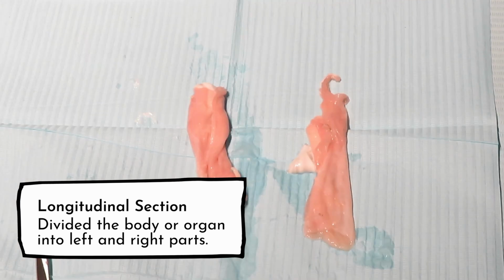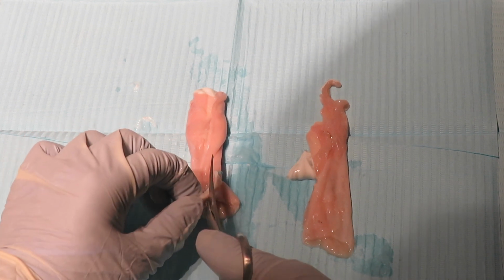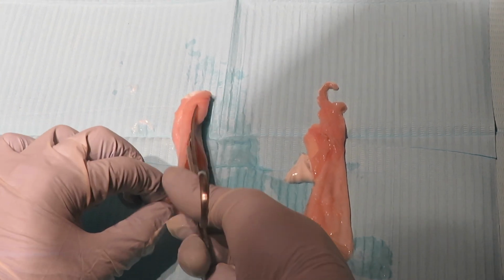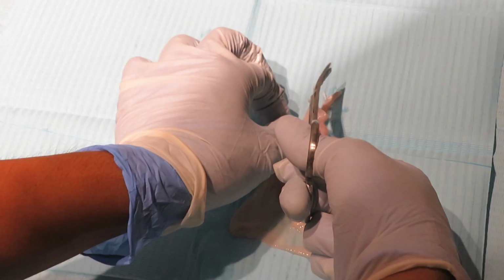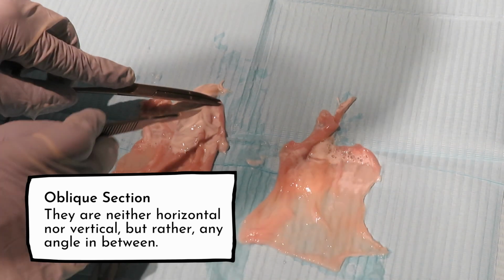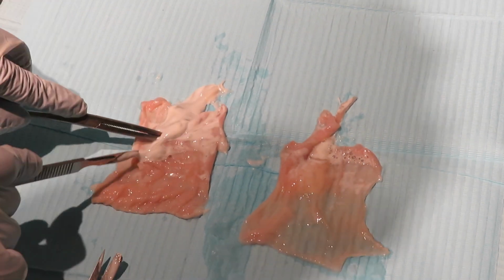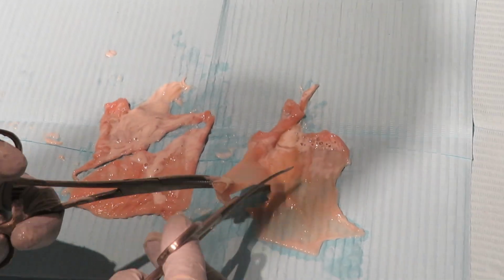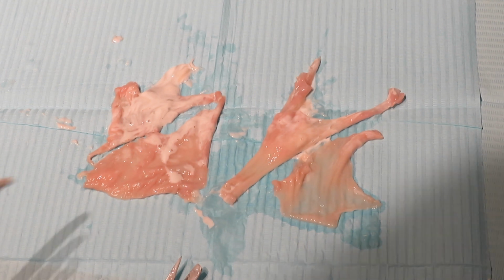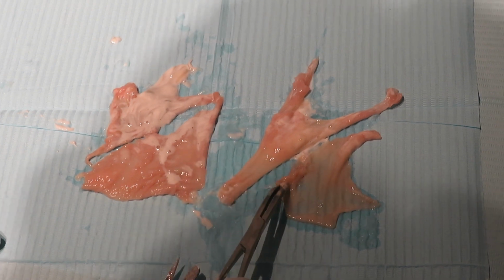Then cut a longitudinal section to examine the stretch of its wall to locate the origin of the infection. And last is an oblique section to examine the extent or depth of the infection along the walls of the intestine. As you can see, an abscess is evident in this part. This tender mass had ruptured which eventually led into sepsis, and this would be the possible cause of the death of the piglet.